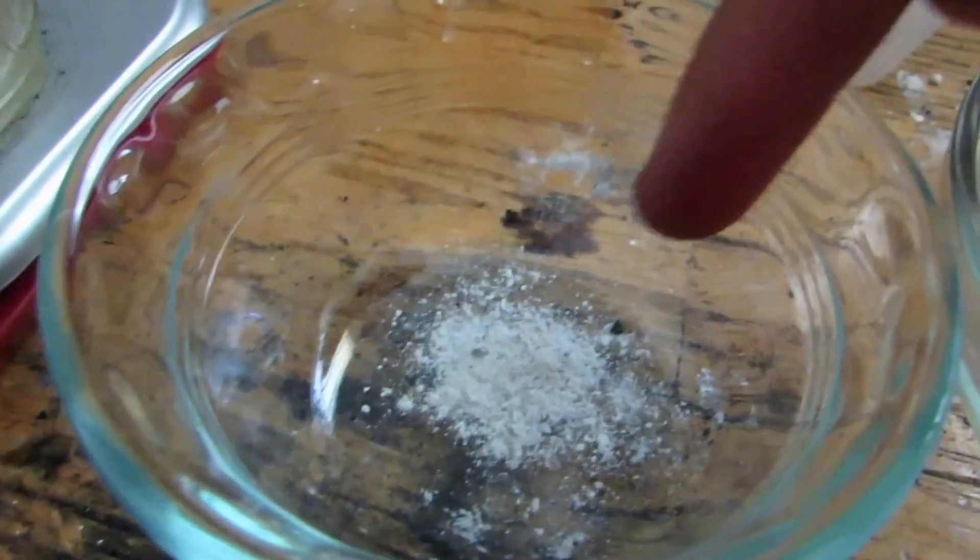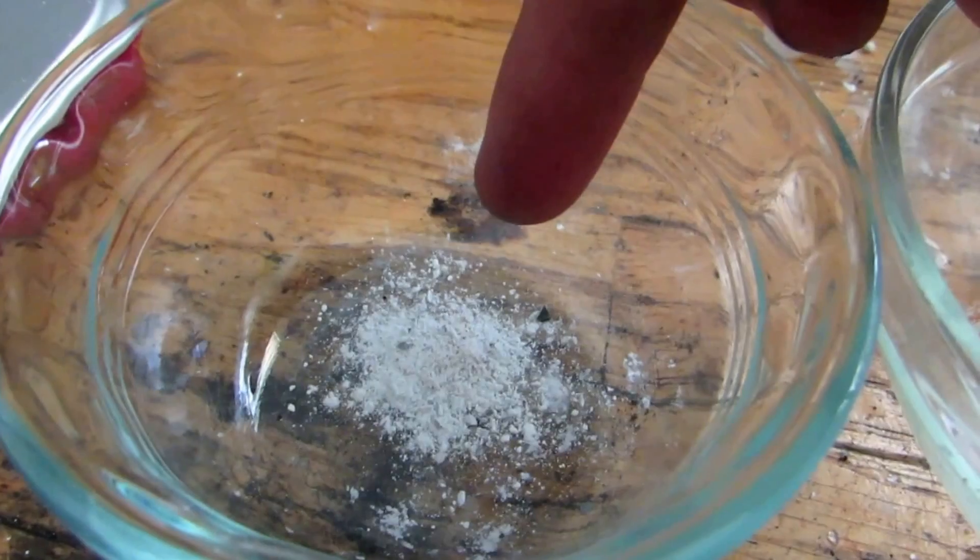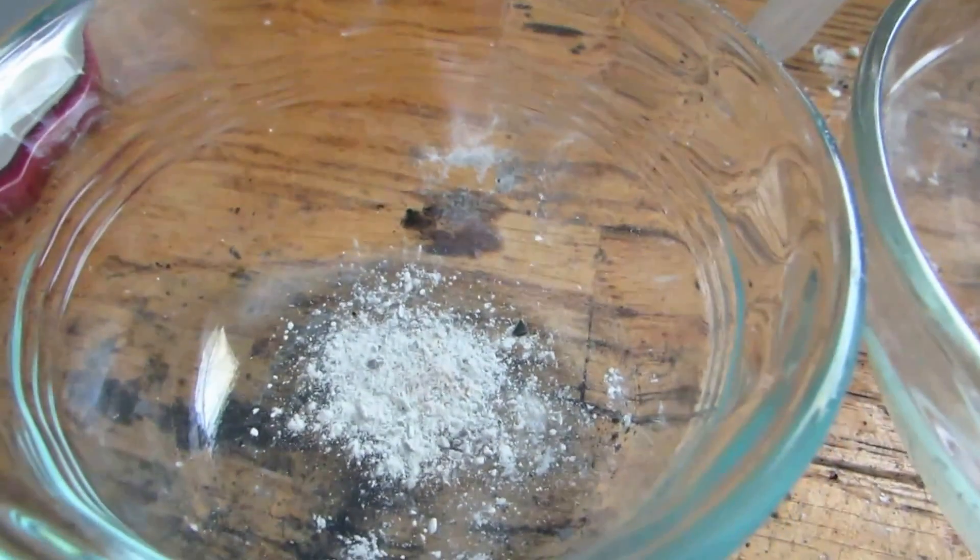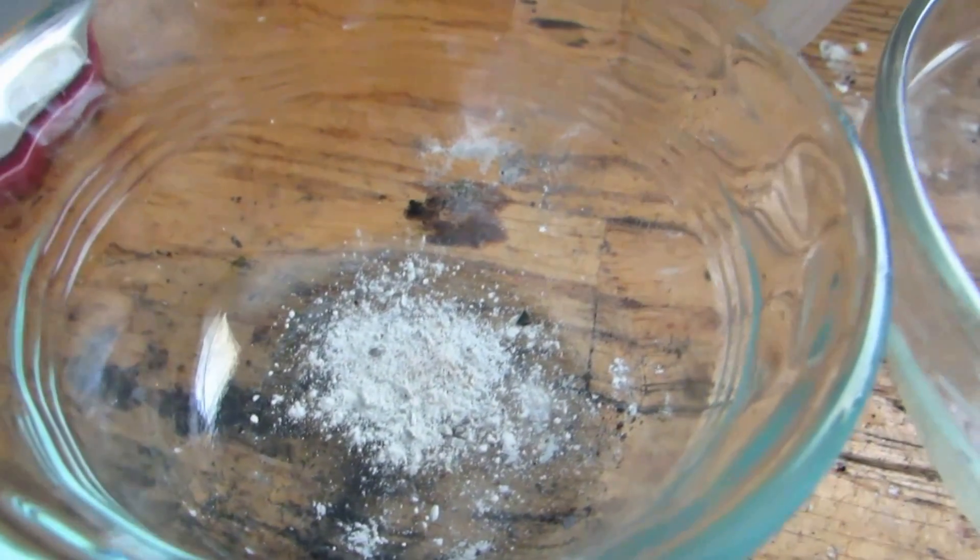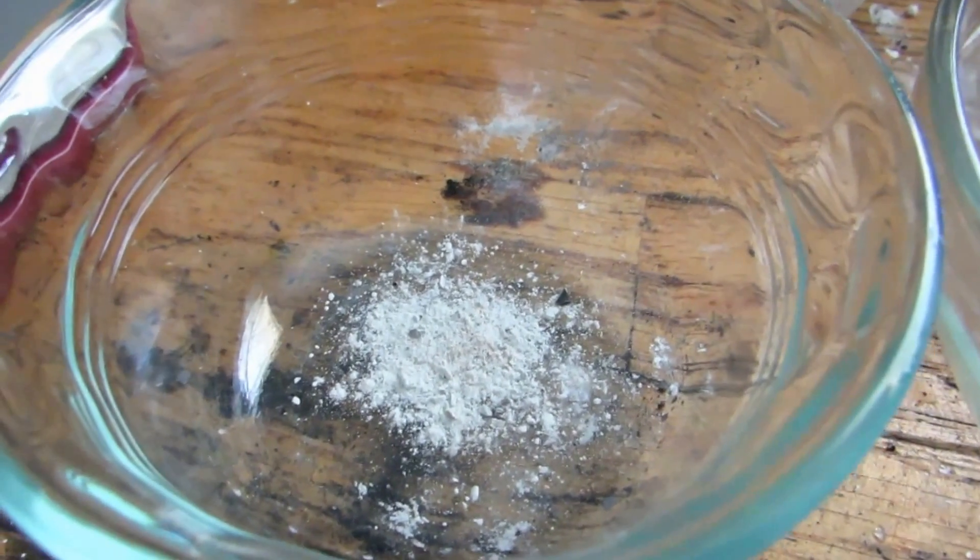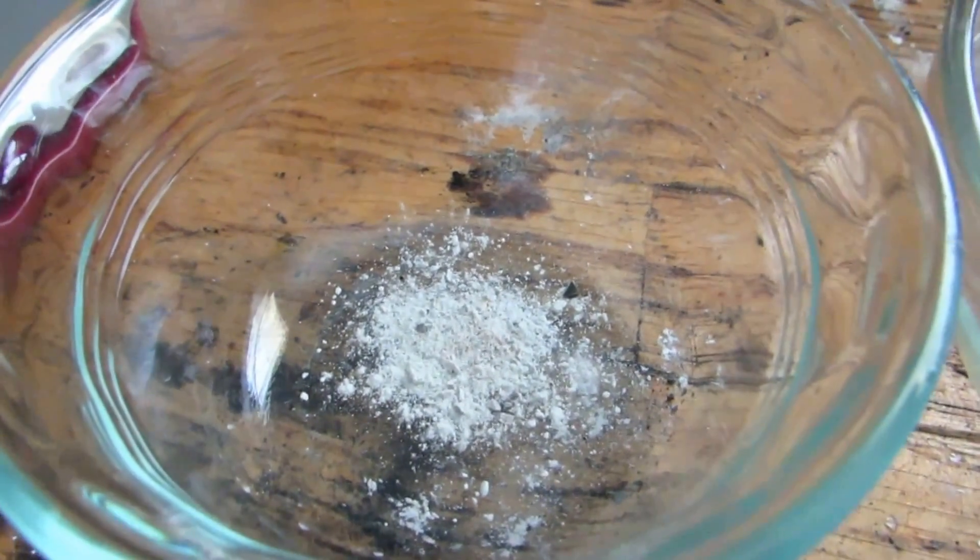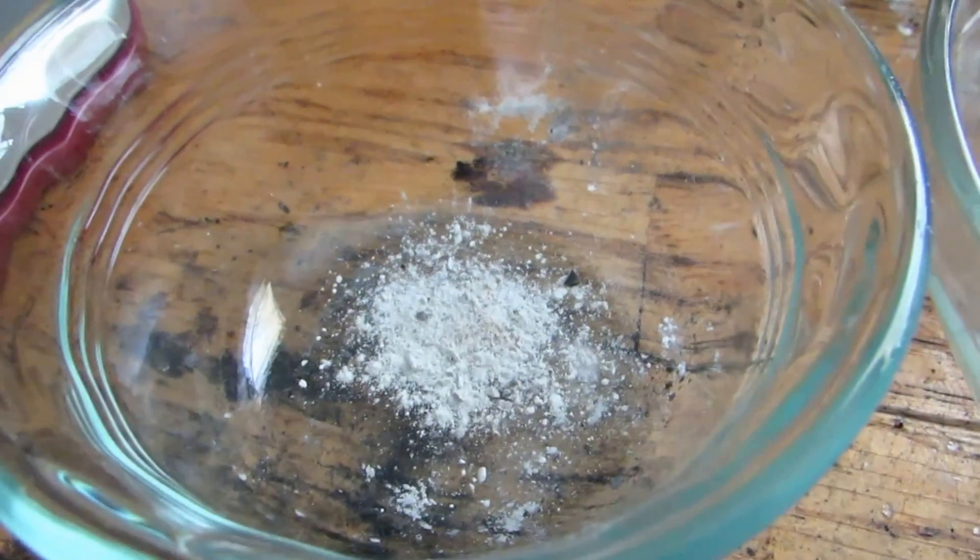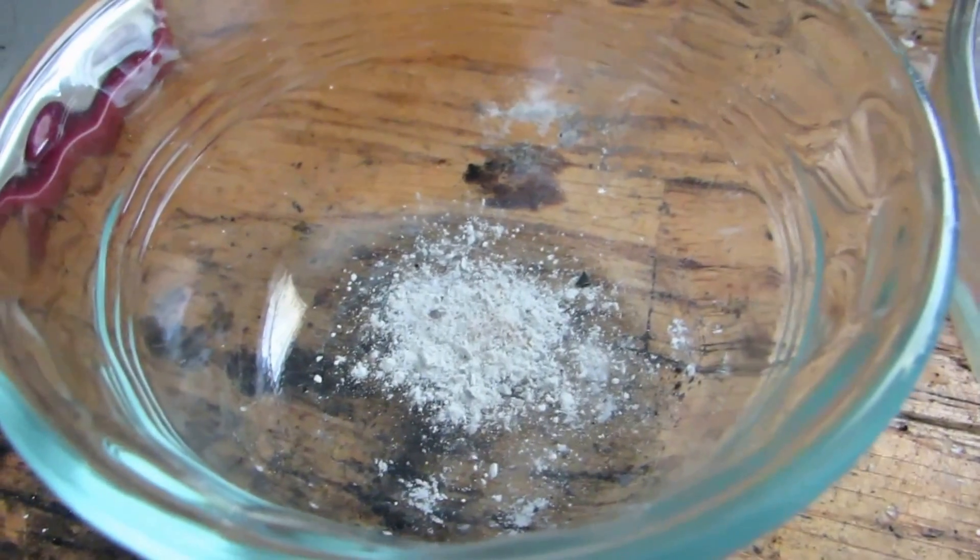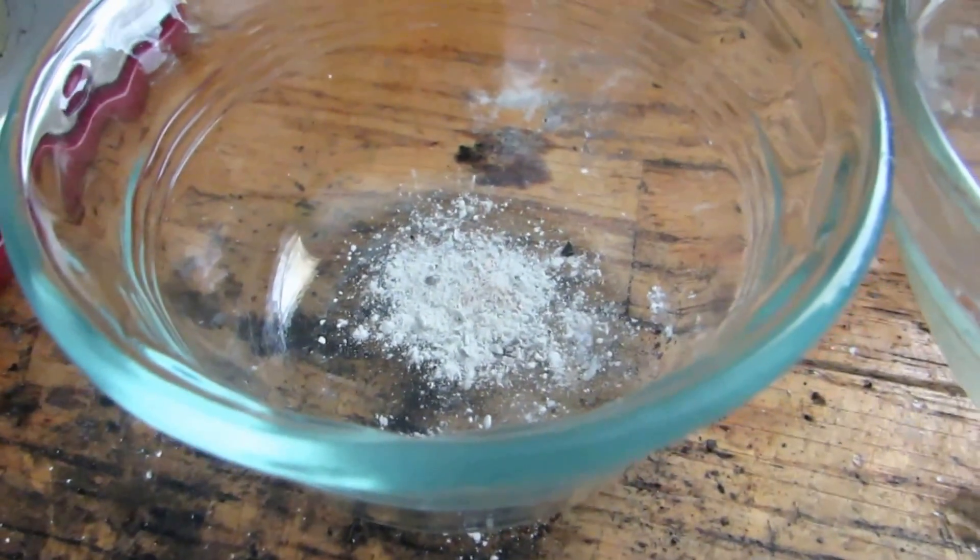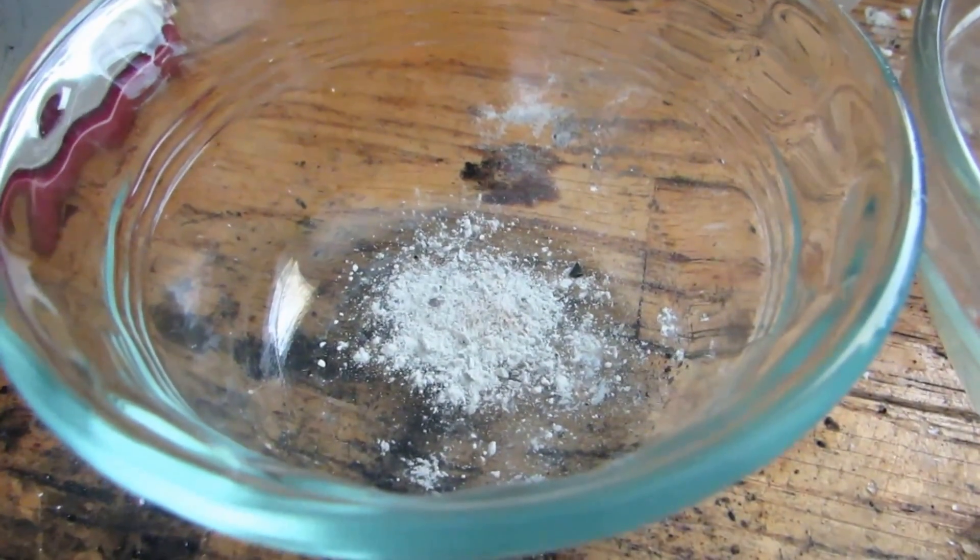And here's the strontium chloride, or I'm not sure if it's strontium chloride yet because I haven't flame tested it, but it's some sort of compound which gives the color. So that's how that particular type of firework worked, and I don't know how different fireworks are going to work because obviously different models are going to be different compositions and stuff.